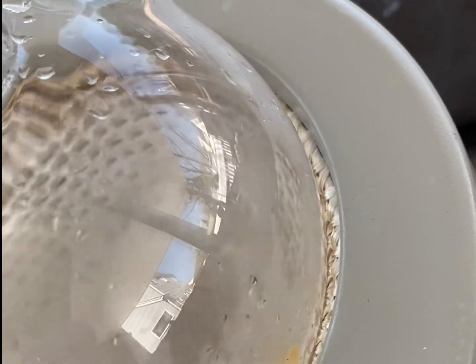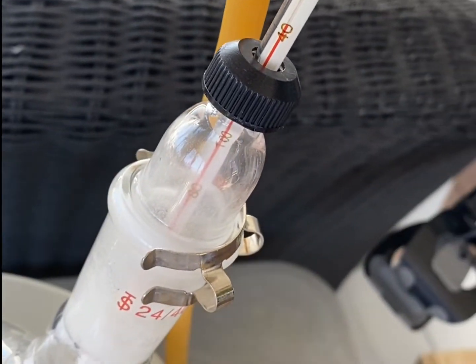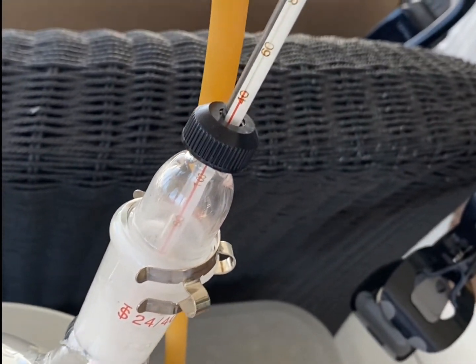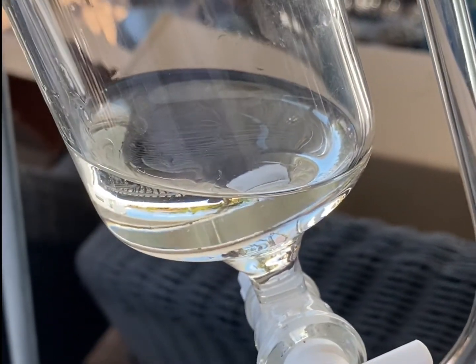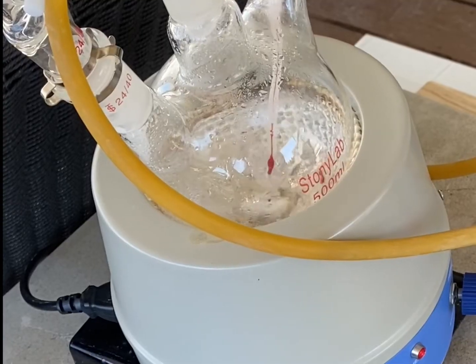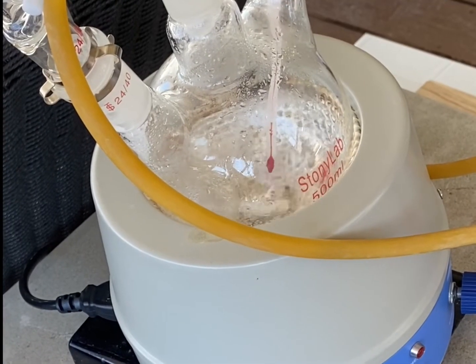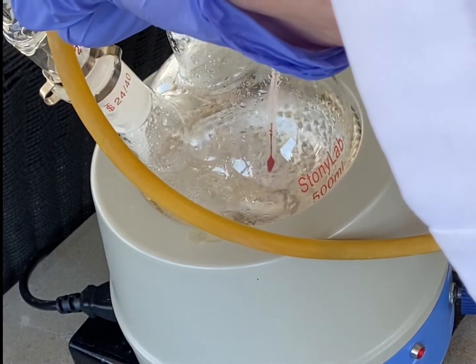It's flowing liquid, and the temperature is about 104 degrees C. Once it gets to around 160, we'll start dripping in the sulfuric acid, which I have loaded into the addition funnel. The temperature is around 160 degrees now, so we will start the addition of the sulfuric acid at a slow pace.